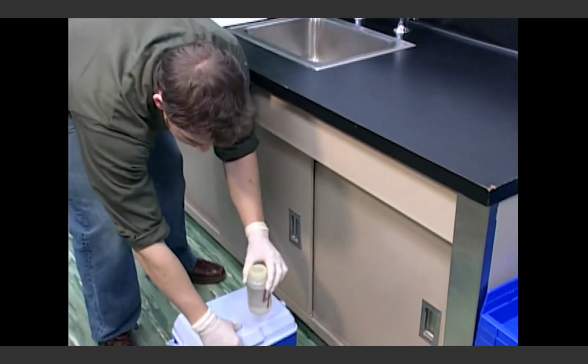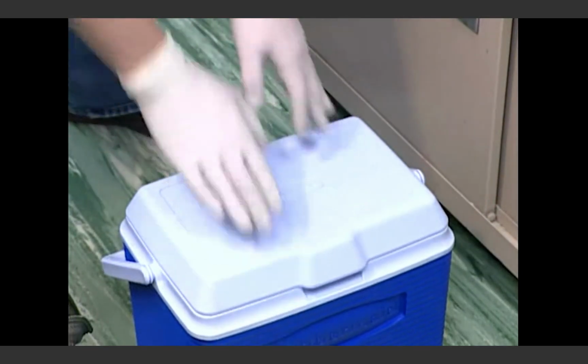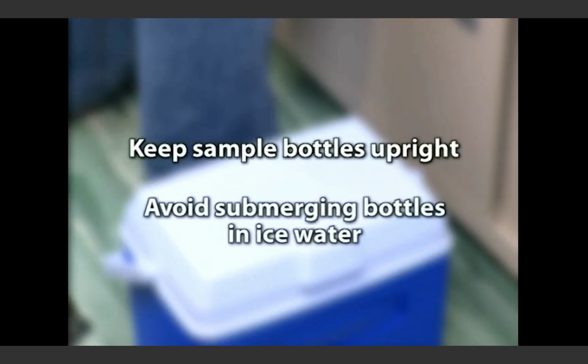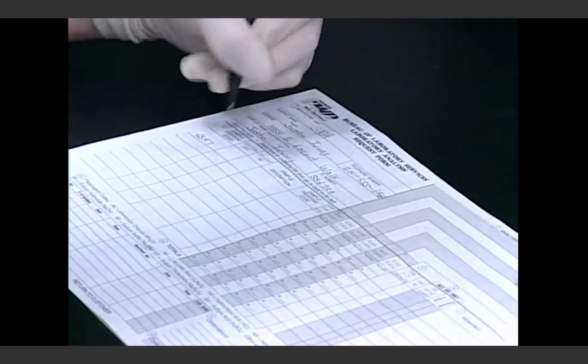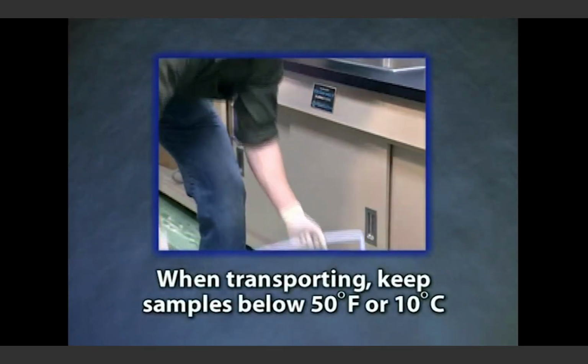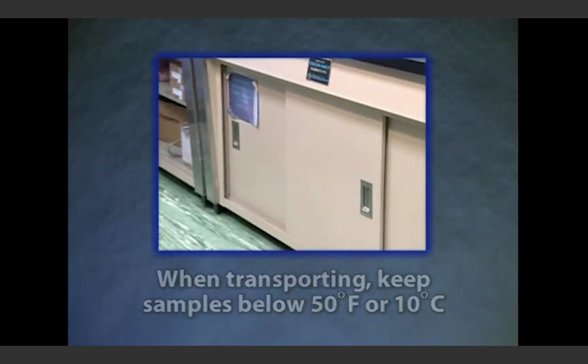When finished, carefully replace the bottle lid, tighten, and place in the cooler on ice or ice packs and out of the sunlight. Keep sample bottles upright and avoid letting them become submerged in melted ice water. Recheck the information on the label and complete any unfinished forms that came with the sample bottle, including the chain of custody form. When transporting, keep the samples at less than 50 degrees Fahrenheit or below 10 degrees Celsius.